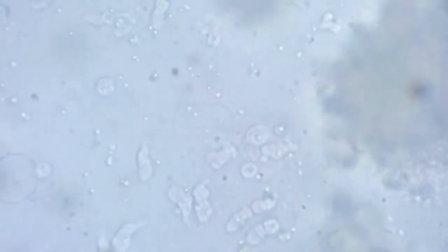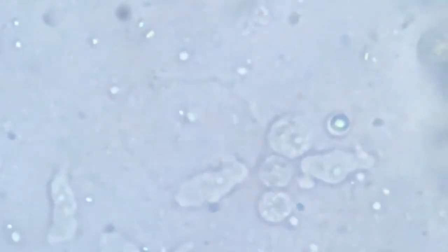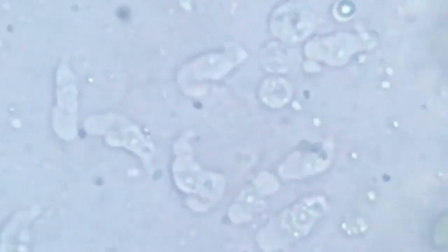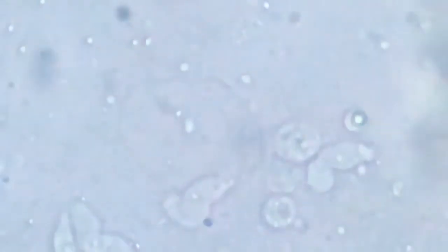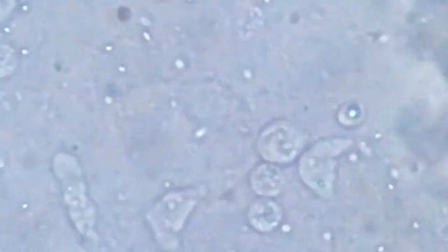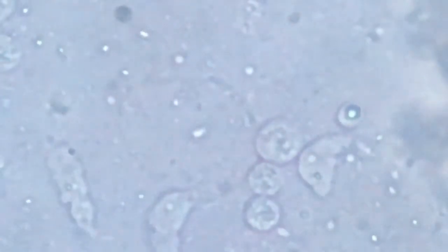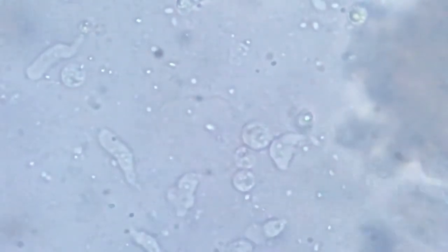Oh goodness, this one swims so nice. Such a beautiful sight. Now we go further and find some more.